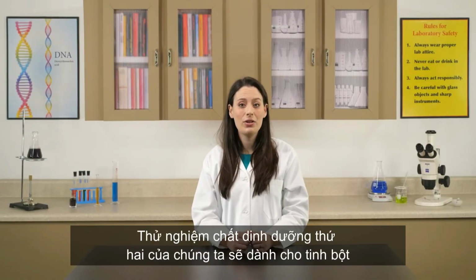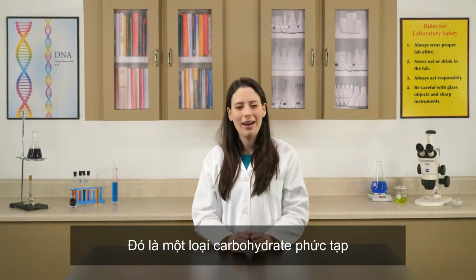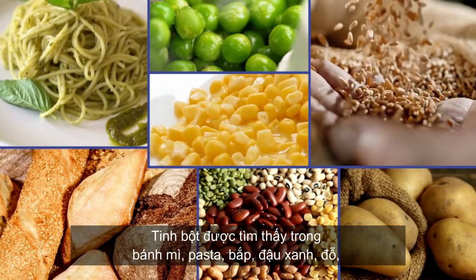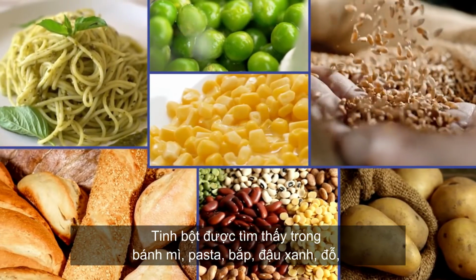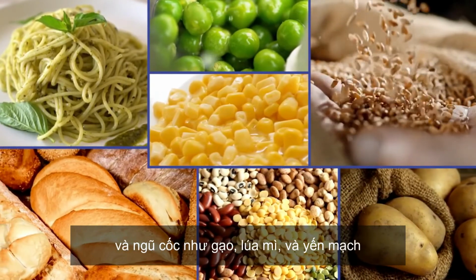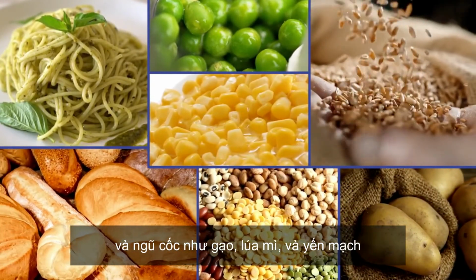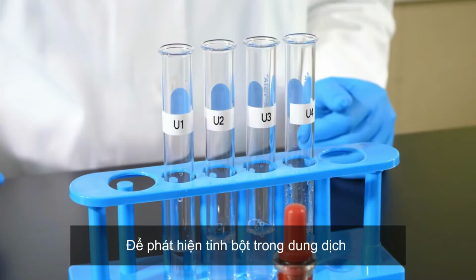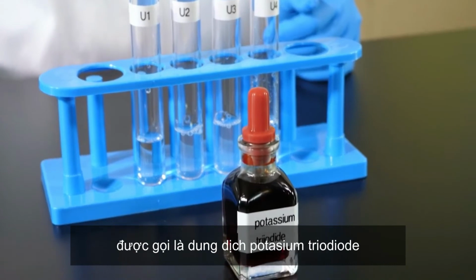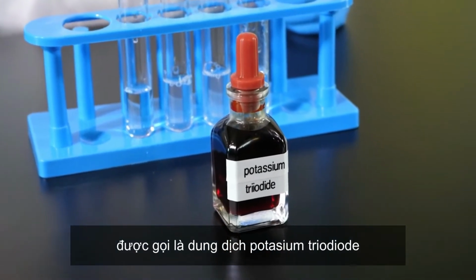Our second nutrient test will be for starch, which is a complex carbohydrate. Starch is found in bread, pasta, corn, peas, beans, potatoes, and cereal grains such as rice, wheat, and oats. To detect starch in a solution, we use a chemical indicator called potassium triiodide solution.